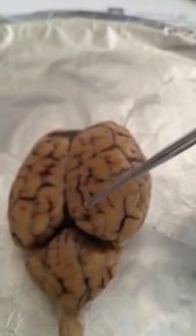If you move back the cerebellum a little bit, the occipital lobes are back there in the back, the right and left occipital lobe. Number 2, it says to demonstrate and describe what a gyrus is.